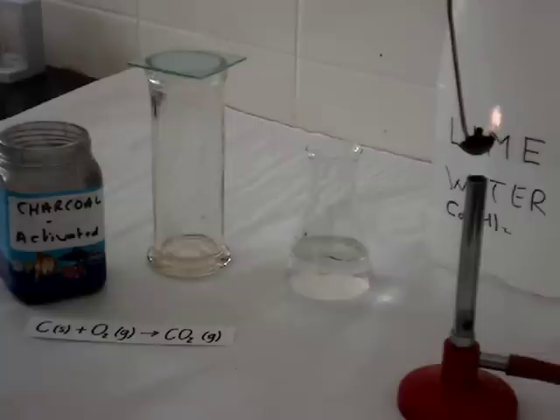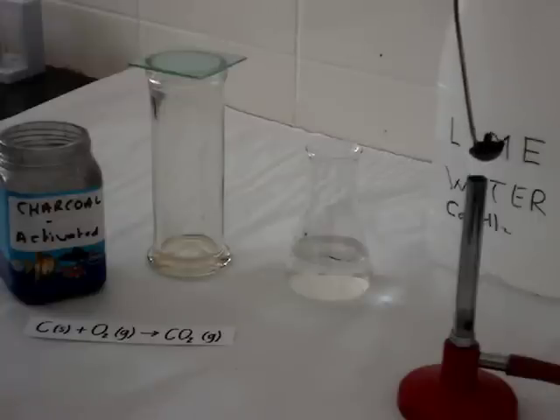Carbon dioxide gas is colourless, but we can detect its presence by adding clear lime water. The test for carbon dioxide is that clear lime water turns milky. So that's what we'll see.